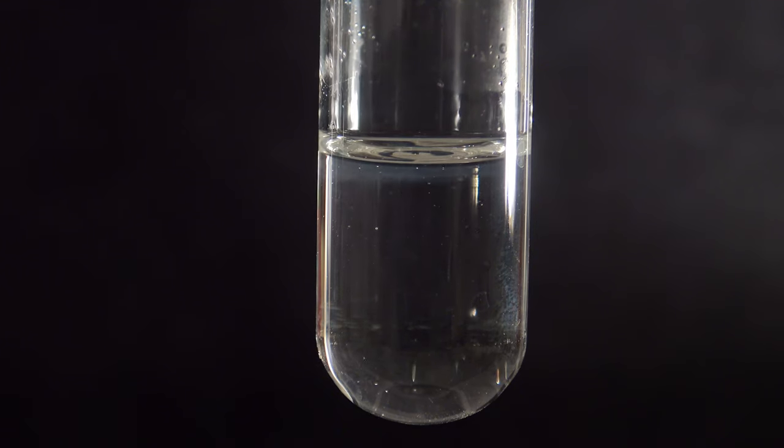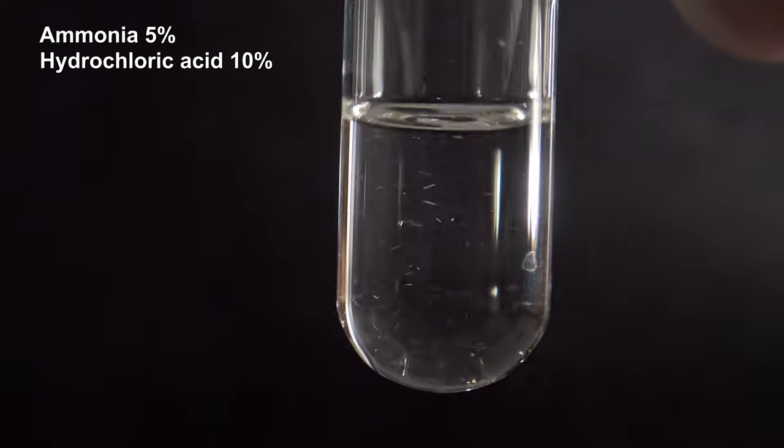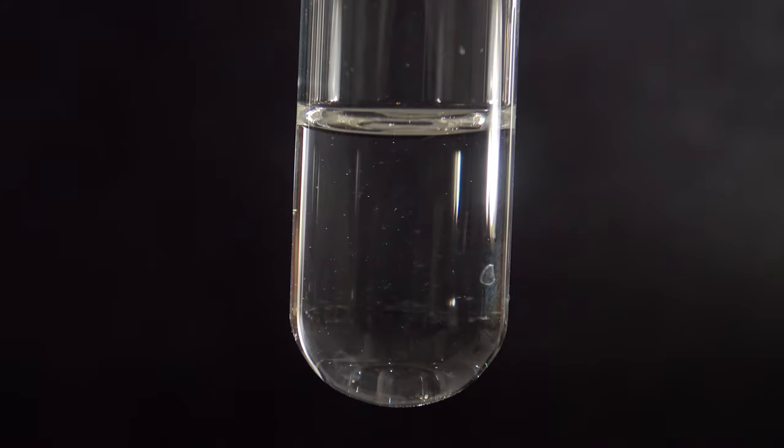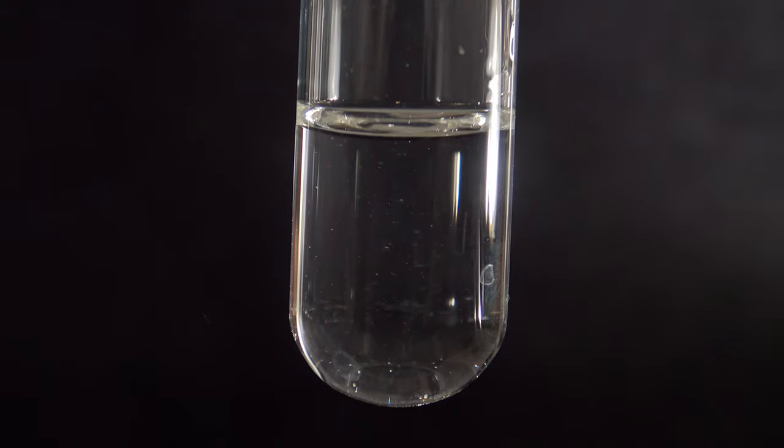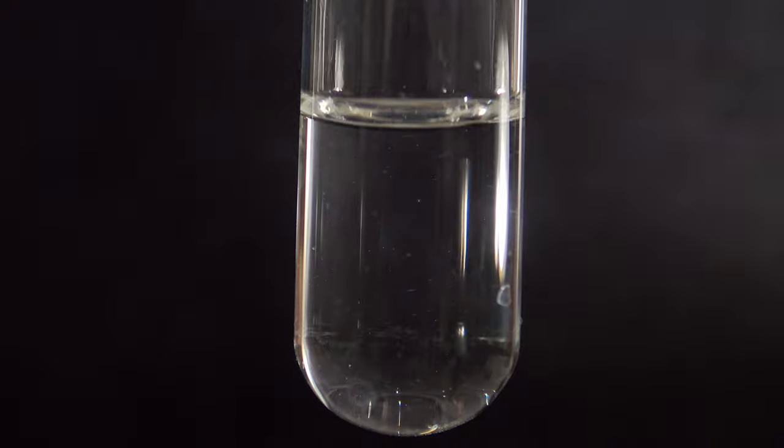Next, the solution was neutralized with 5% ammonia and 10% hydrochloric acid. After every addition, the test tube was shaken and the pH was tested.